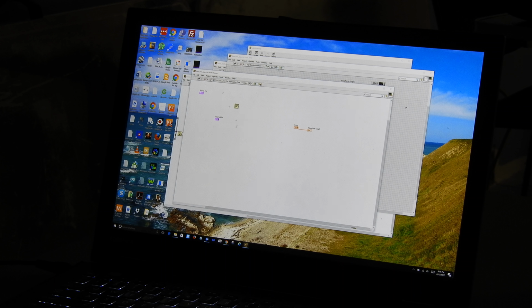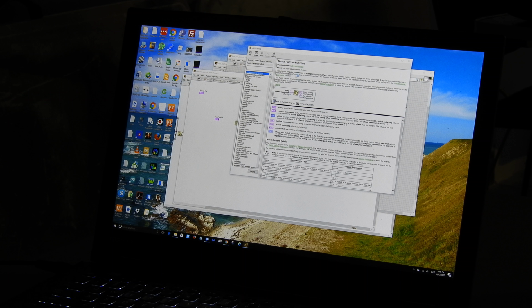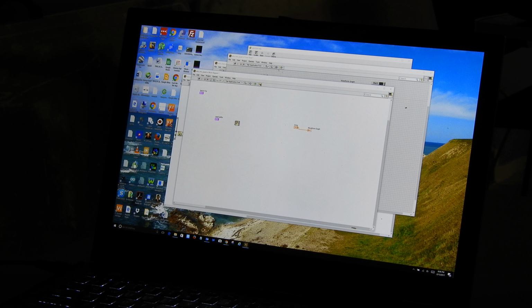Okay, so let's see how I parse this. All I'm going to do is take the input regular expression and string. Oh boy, which one was which? I forget. Okay, input string is where we put read buffer. So this goes to read buffer. The searched string, what we're looking for, goes in this. We're not going to wire anything to the offset because we want it to start at the beginning, and its default value is 0. And now let's just take a look at what we get out of this. So I'm going to right click on this, say create indicator, and then I'm going to right click on this third one, create indicator.